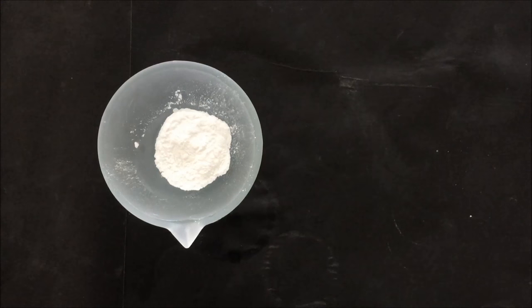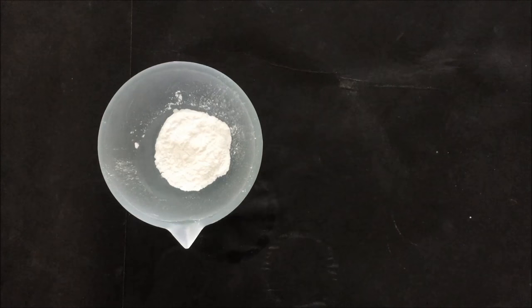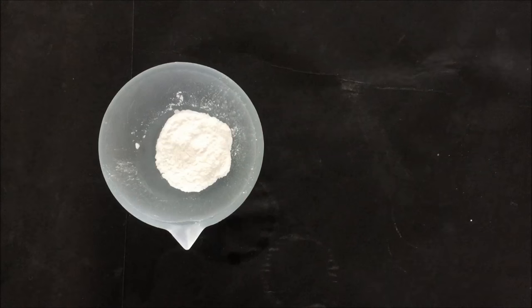TLC plates means thin layer chromatography plate of which one side is coated with adsorbent. The most common adsorbents are silica and alumina. Here we have taken silica gel G as adsorbent.